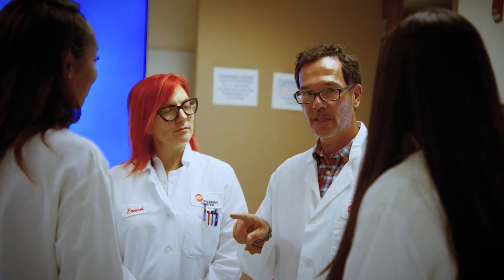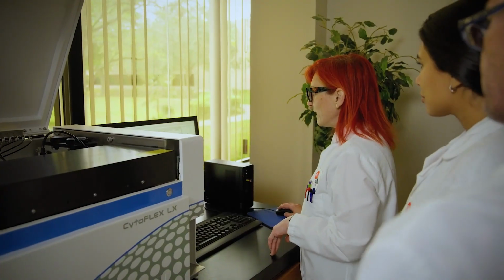CytExpert Spectral software offers 2 different algorithms, LSM, and a new Poisson hybrid that has shown to reduce signal spreading, enhancing data quality. An automatic unmixing check of all the plot combinations will be generated to show if there is any issue and pointing out exactly where, to aid you with your experimental troubleshooting.